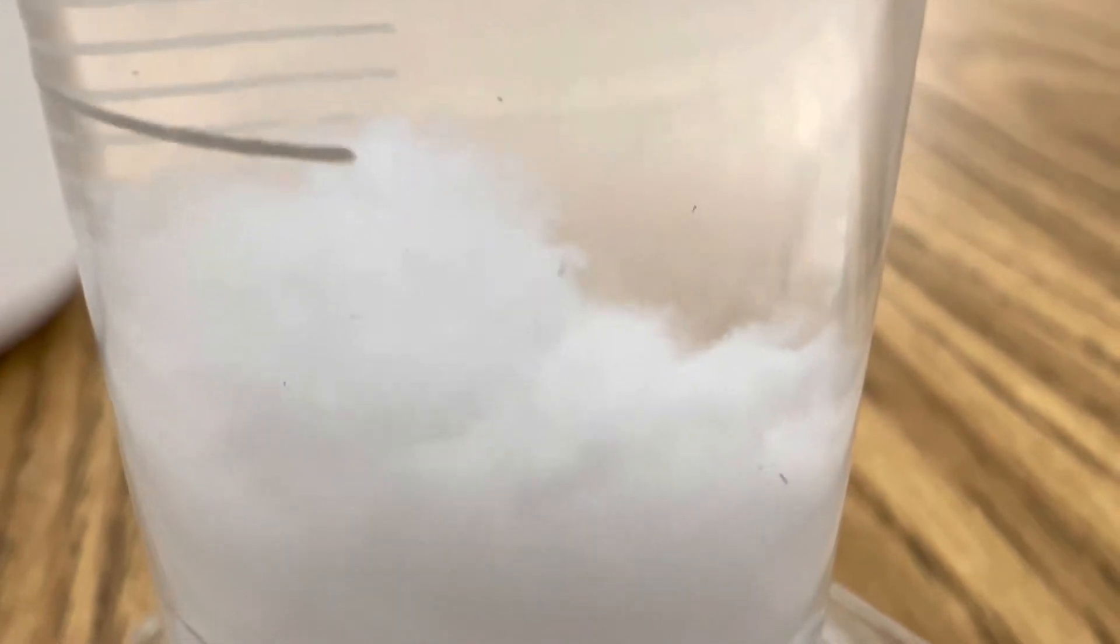So as you're looking at this crystal as it forms in the solution, just know that strontium sulfate is used to treat water. It's also used as a colorant in ceramics and glass. Check it out. Just beautiful. Wow. Sort of looks like it's snowing.